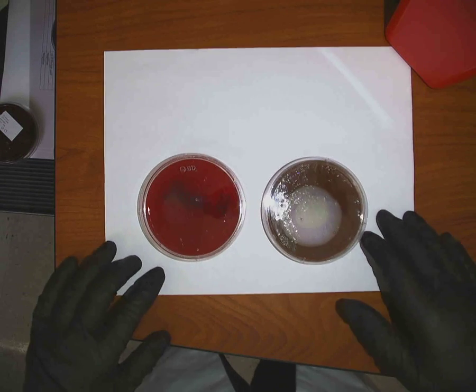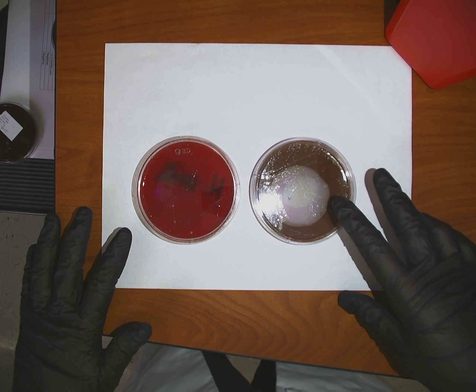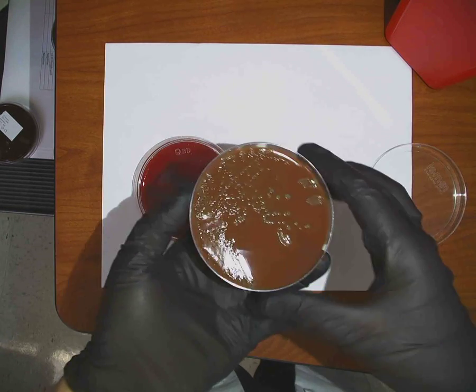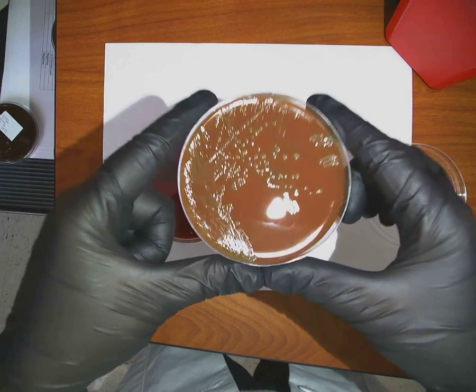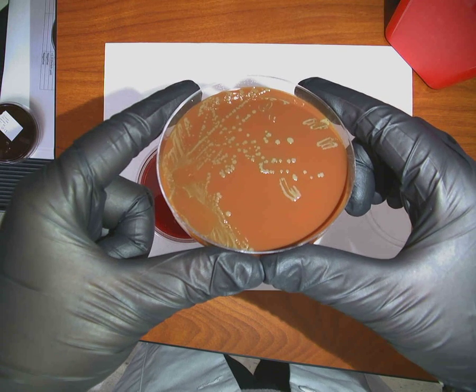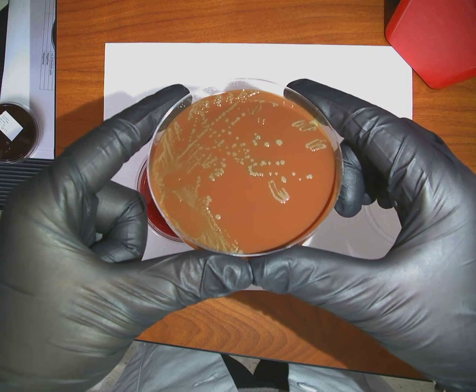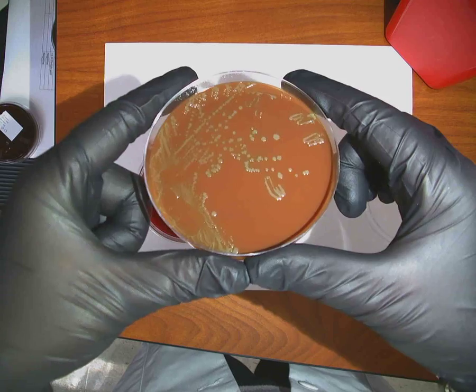Sputum culture from a 65-year-old patient who came into the hospital just fine but had to go on a ventilator and now she has pneumonia. So I have this. Now that color right there is kind of greenish almost. It's a tan to a greenish color. It's an odd color, and it smells horrific. It's awful. It's musty and mousy smelling. I want to gag. It's nasty. Okay, but that's a tan to almost a greenish color.